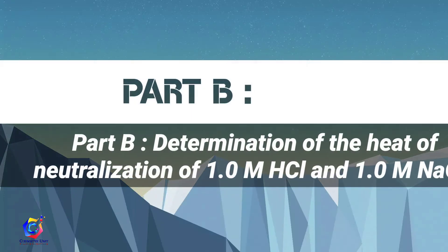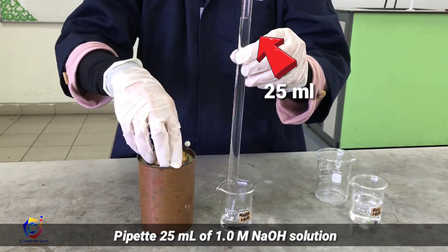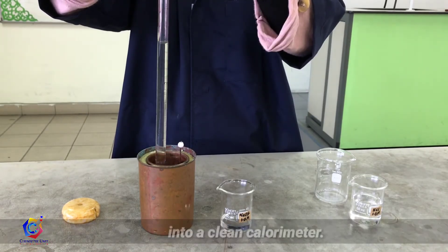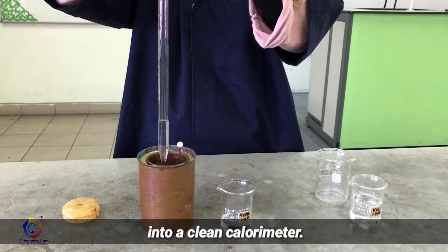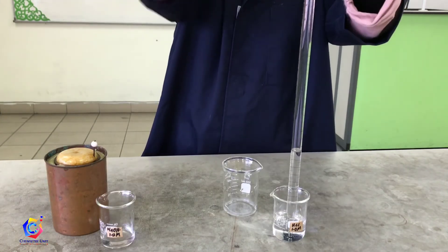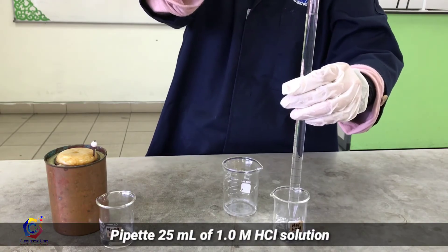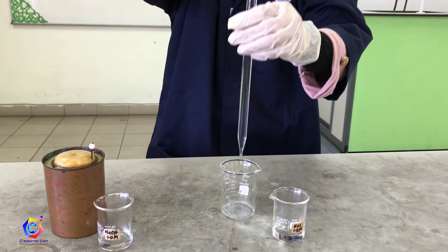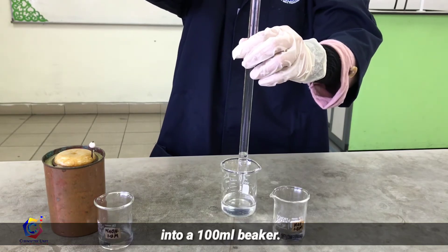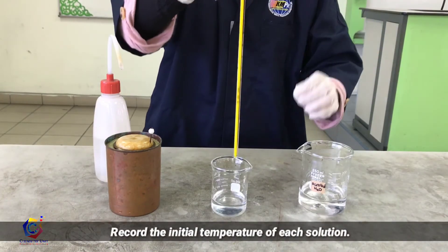Part B: Determination of the heat of neutralization between sodium hydroxide and hydrochloric acid. Pipette 25 ml of 1 molar sodium hydroxide solution into a clean calorimeter. Make sure that the temperature of the calorimeter has returned to room temperature. Pipette 25 ml of 1 molar HCl solution into a different 100 ml beaker. Record the initial temperature of each solution.